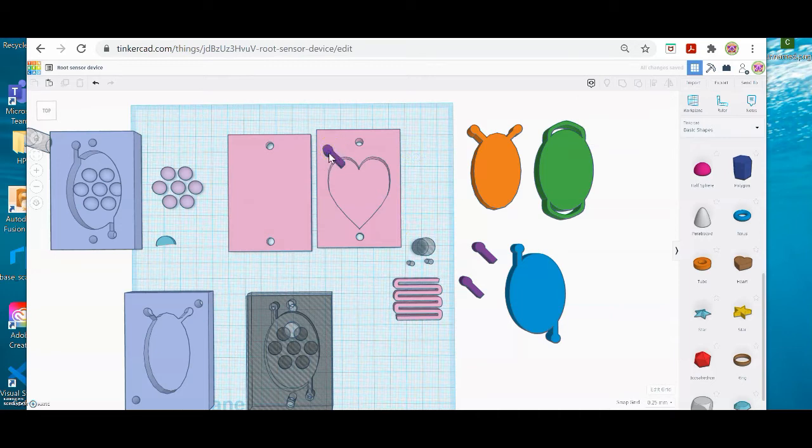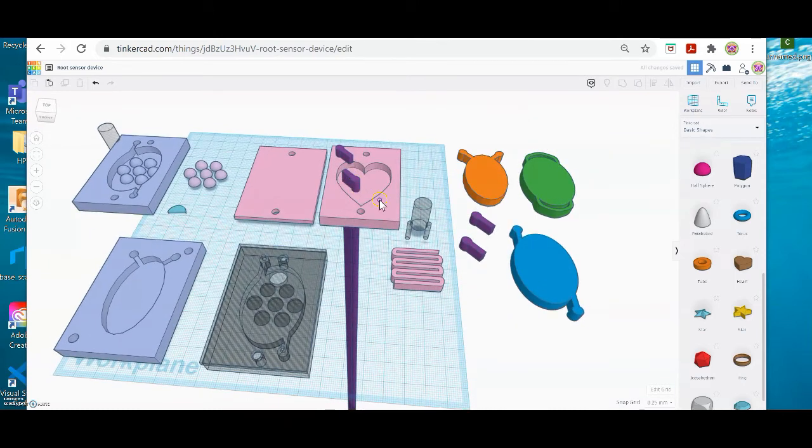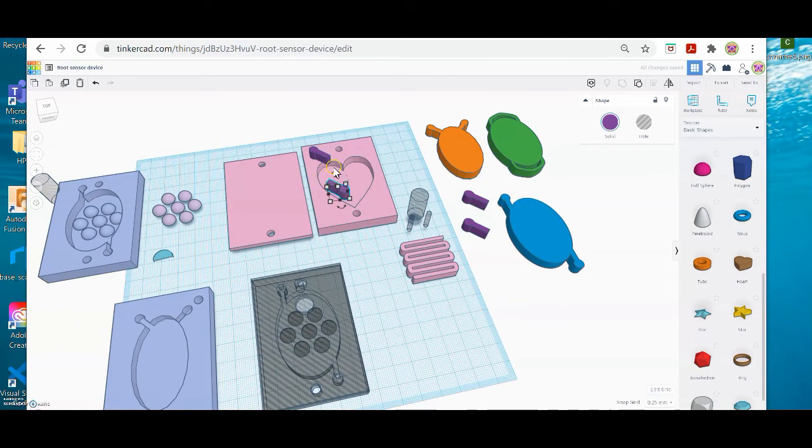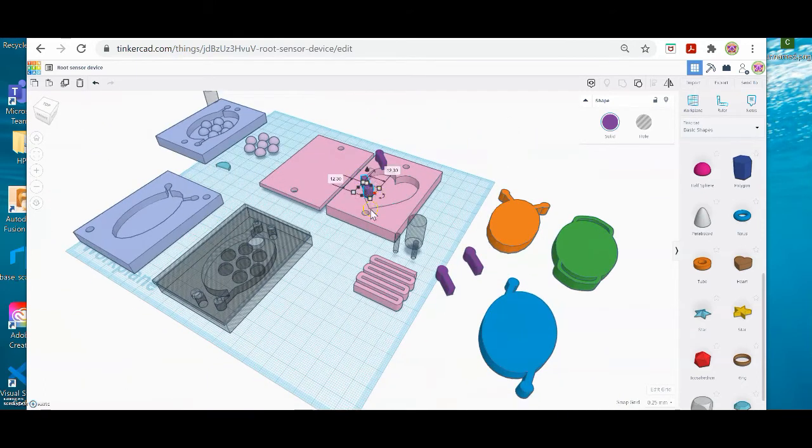Okay, so I want a port here, and maybe I want my second port down below. I'm just going to use my arrow keys to do this. Let me get this view. Whoops. Let me redo that. Control C, Control V. I can rotate it by just grabbing a rotational arrow. Every object has 3 arrows that enable you to rotate it in 3 different orbits, planes. So it's got one at the top, one at the side, and you need to shift a little bit in order to see all of them.